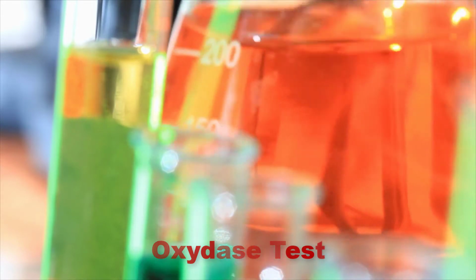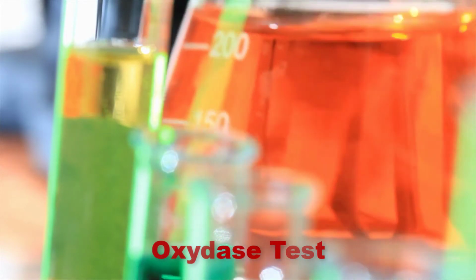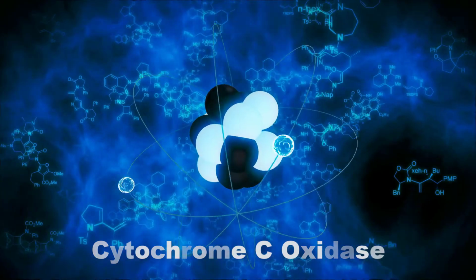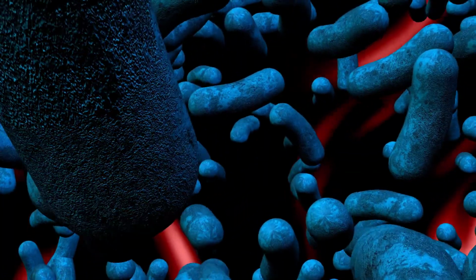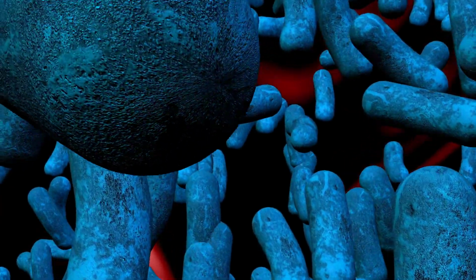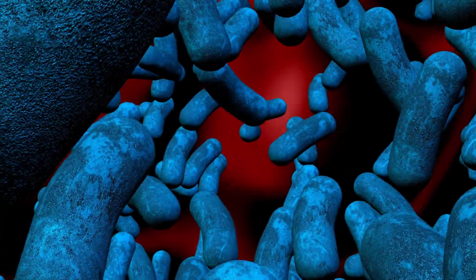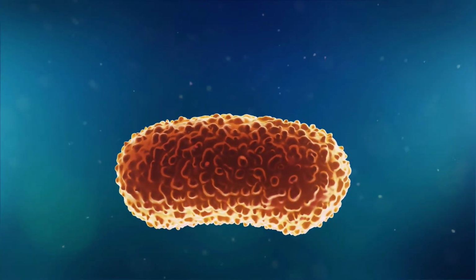Our next test is the Oxidase Test. The Oxidase Test is used to identify bacteria that produce cytochrome C oxidase. Cytochrome C oxidase is an enzyme of the bacterial electron transport chain. Note, all bacteria that are oxidase positive are aerobic and can use oxygen as a terminal electron acceptor in cellular respiration. This does not mean that they are strict aerobes, however.